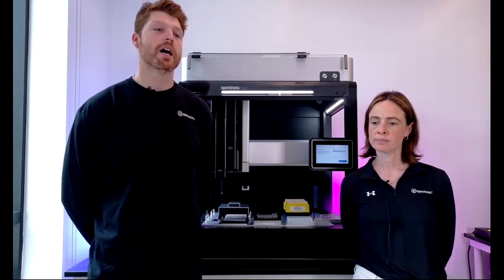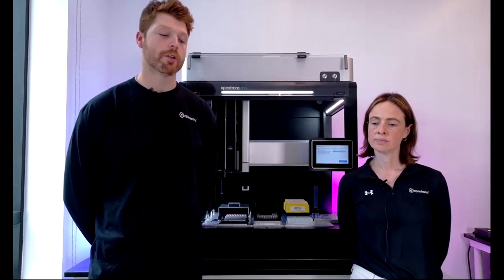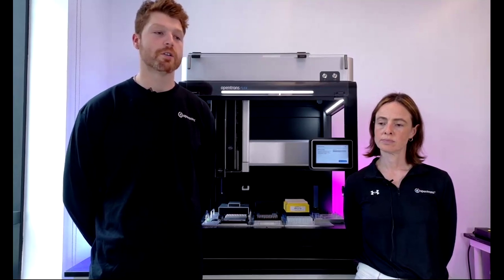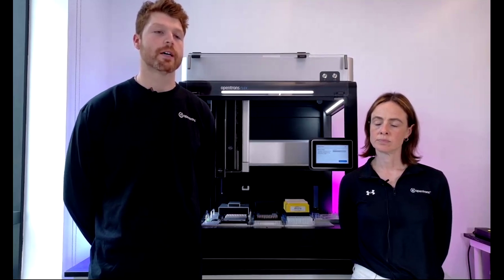Okay, Jan, do you have any protocols for checking the pipette volumes if they live up to specifications? So we do actually have an upcoming IQ/OQ project in which an integrated plate reader is going to be utilized for doing functions like that. Currently, all of the pipettes come validated from manufacturing, and customers can set up a gravimetric test as well. But we will be debuting an internal IQ/OQ mechanism through plate reader.